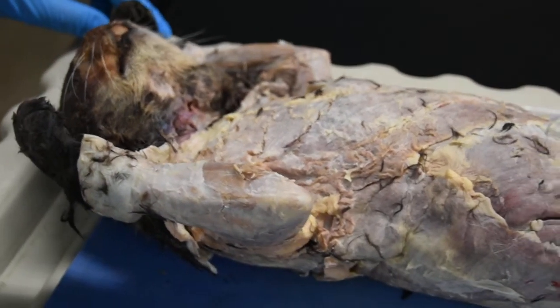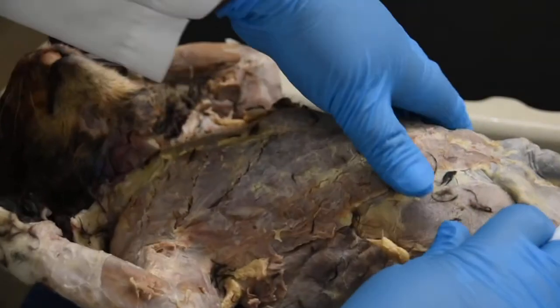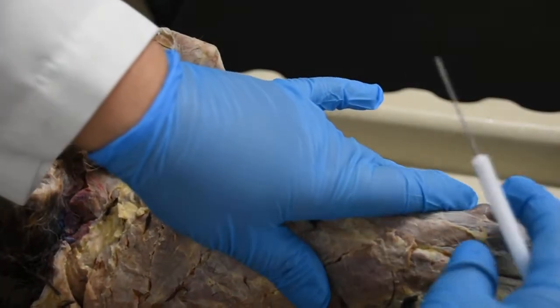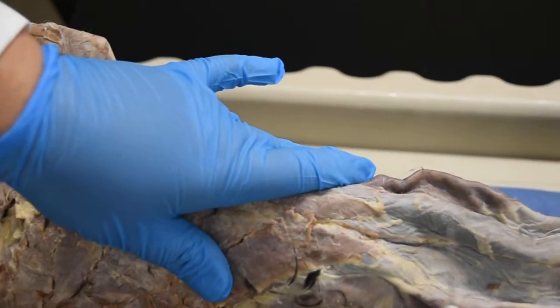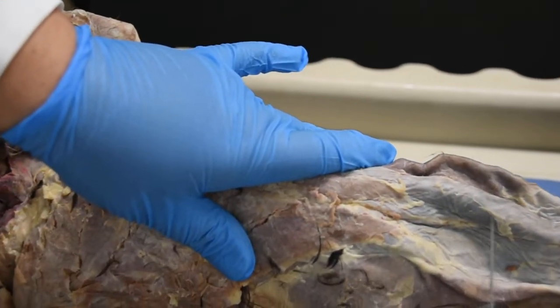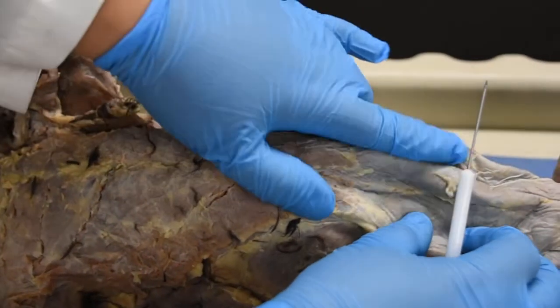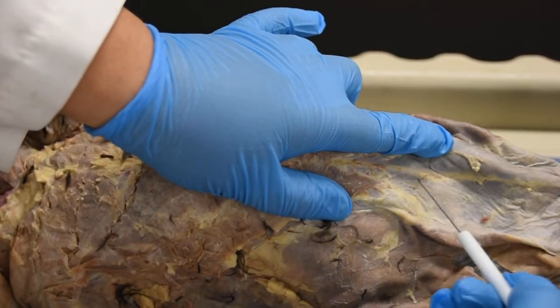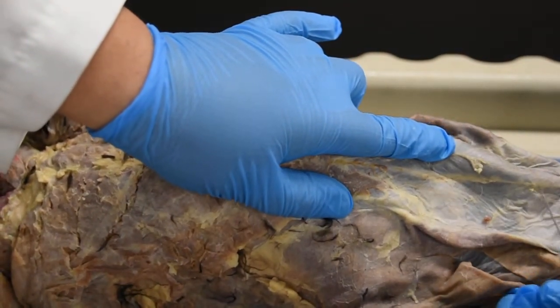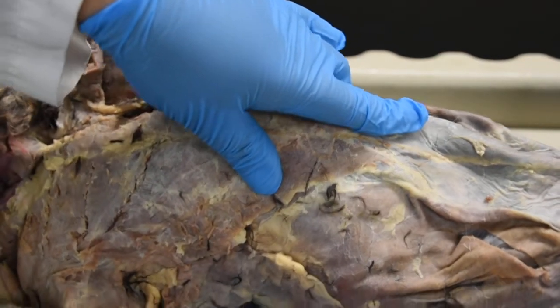Now moving forward, we're looking at the abdominal muscles. The abdominal muscle you have right at the center of your belly, like humans, we have this white fascia. That identifies your rectus abdominis muscle. And then if I open it up, you can see, maybe not as clearly, a white line running right in the middle of this. This line is referred to as the linea alba.